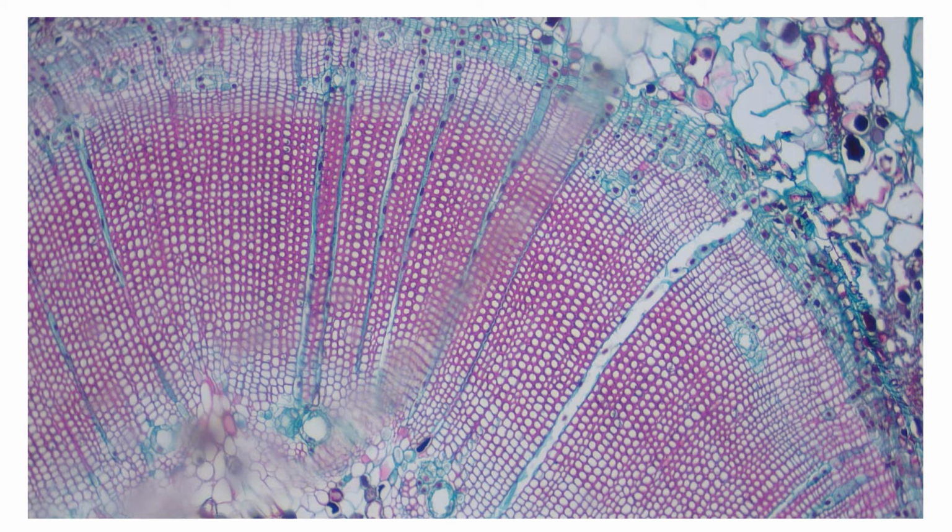But let's examine this closer, and here we have our xylem. And we're zoomed in, so it's a much larger territory, and you can see all of that. And you can also note the small little holes, which represent tracheids, which are individual little cells that are responsible for transporting water in plants. So one of the cells that can do that, and there's a ton of these things. And if you note, they're all pretty much the same size in this pine.